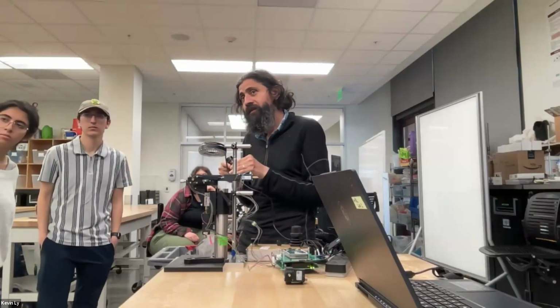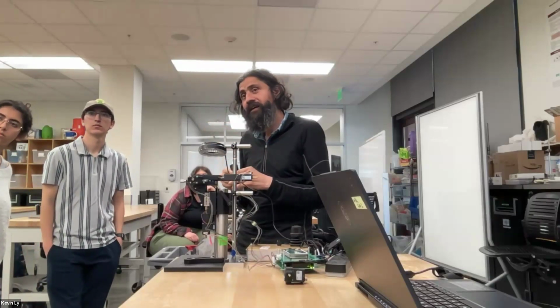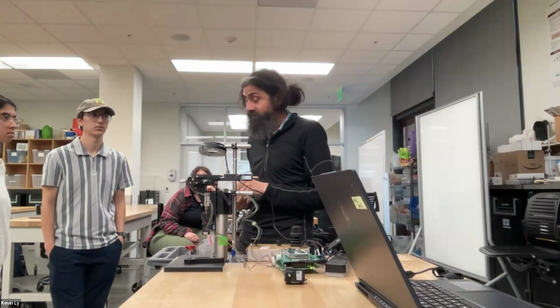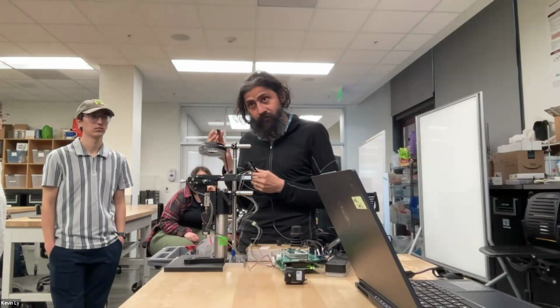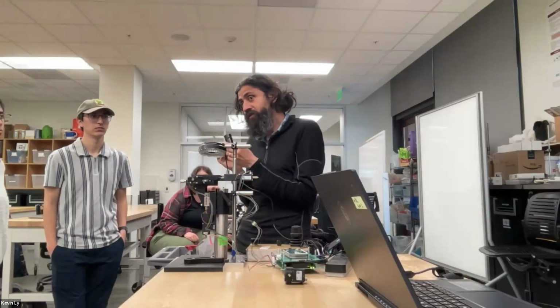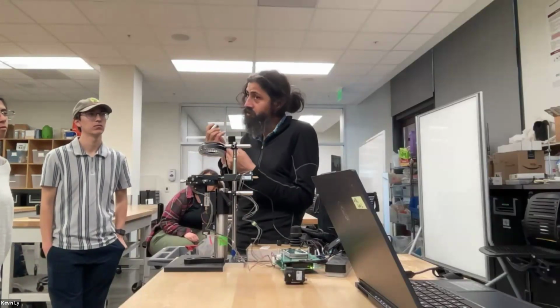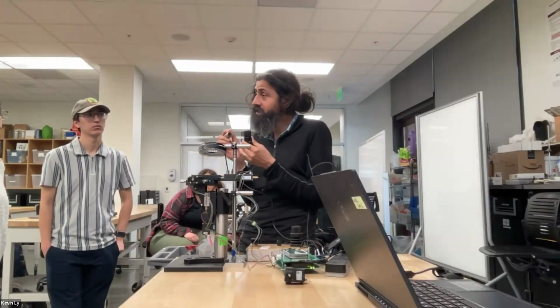Yes. One of the questions before was, how much did you account for the optical glue when you put the two together? Absolutely, super important. So this object has a ton of optical glue. And the way you use the optical glue, we have some, by the way, as you start playing together, which has a known refractive index. And there is a key trick that you use.